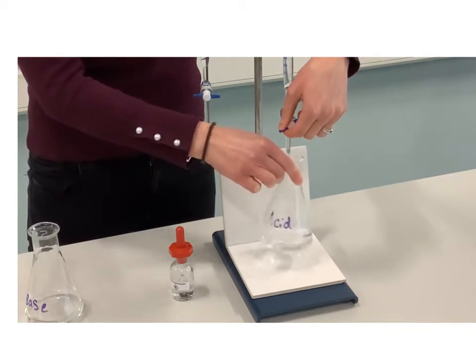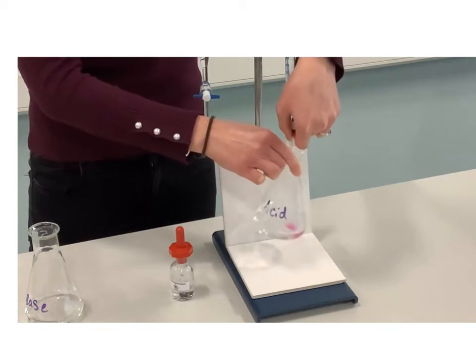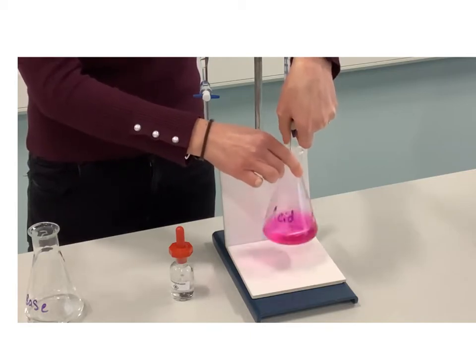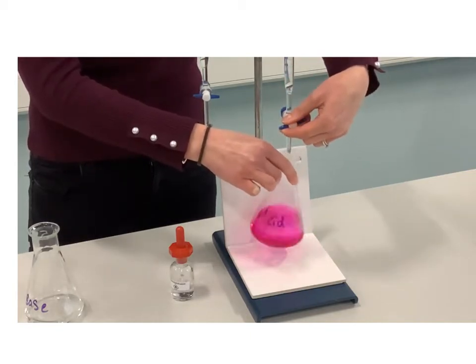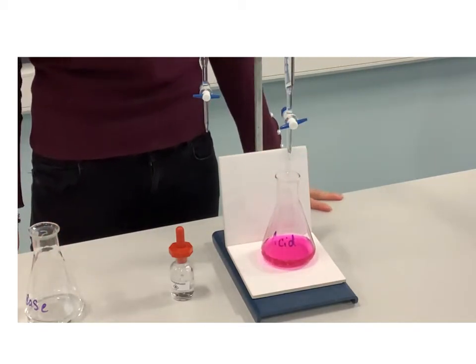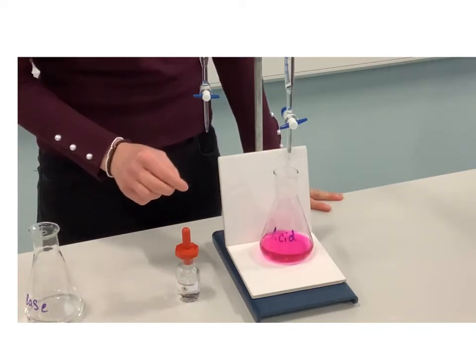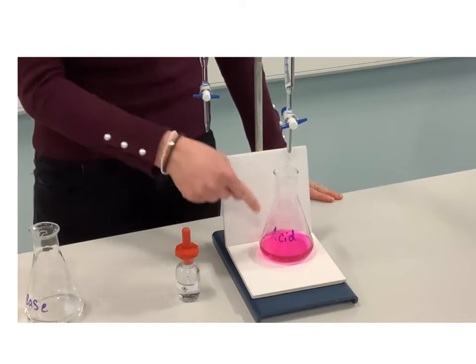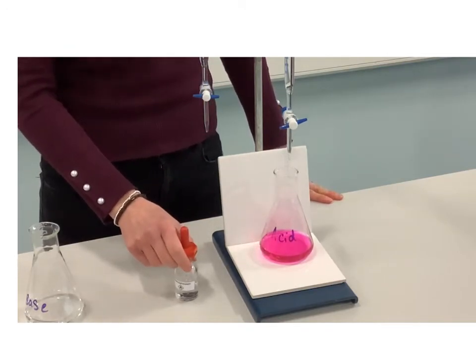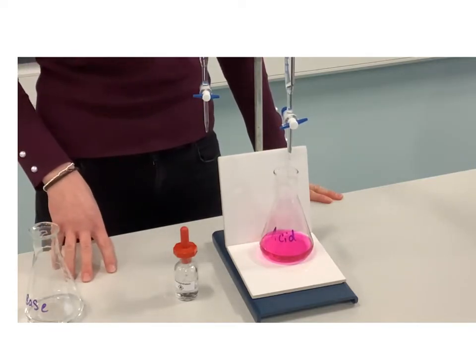I have a white tile at the bottom and at the back of the retort stand just so you can see the color change really well. If I keep adding my base — again I'm not too worried about being accurate — until there's a constant color, you can see that it has turned pink. That's because phenolphthalein is pink in alkali. So when we start with acid in the conical flask using phenolphthalein and add base from the burette, the color change is colorless to pink.